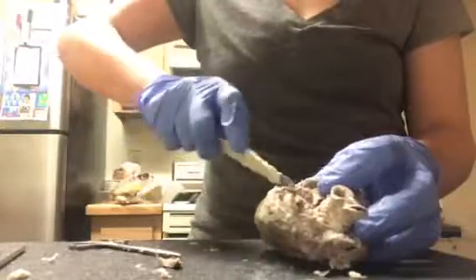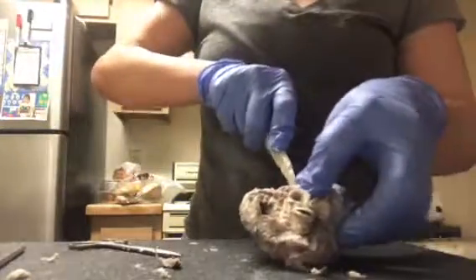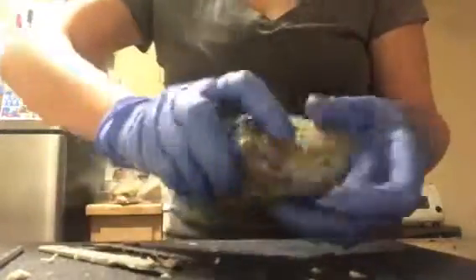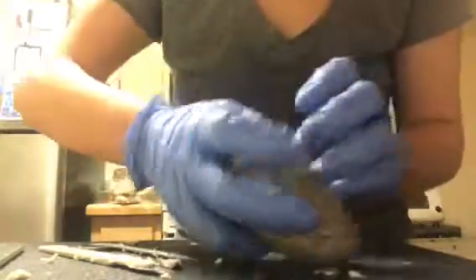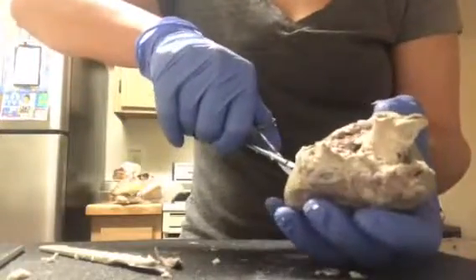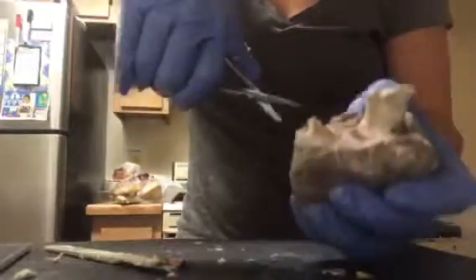I'm going to have to do a little bit more cutting, and I'm going to go from the top and then angle it to go to the bottom. I have pieces here and there. If you look, I'm going posterior, so now I have those pieces so I can cut them out. I'm going to take my scissors and just cut all that excess off.